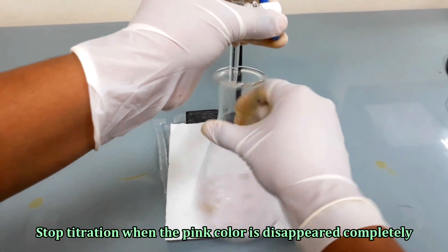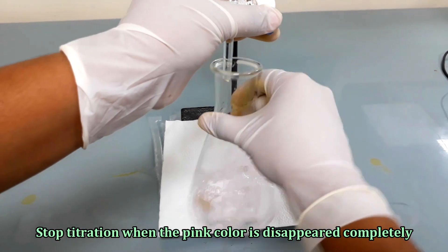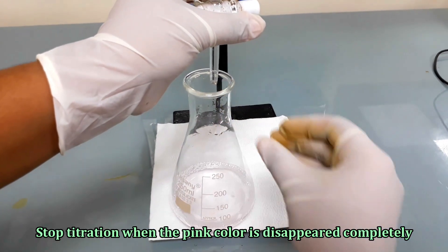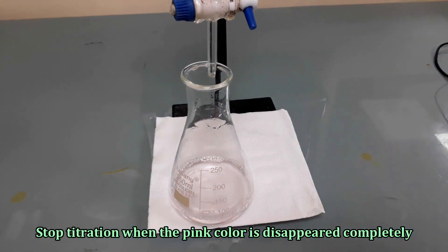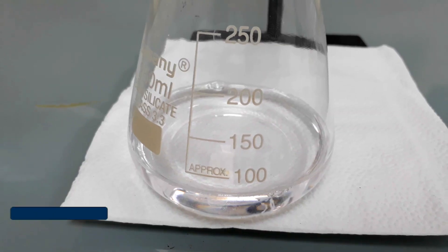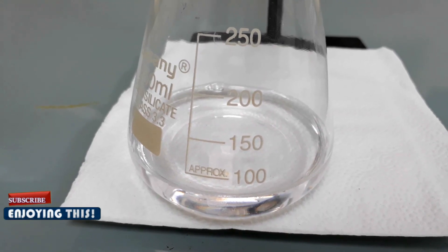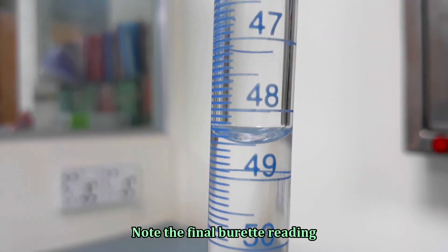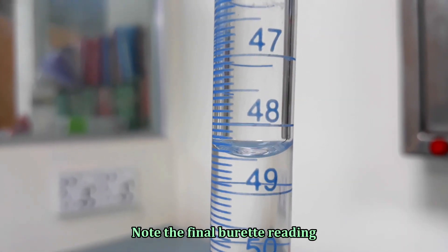Stop titration when the pink color has disappeared completely. Note the final burette reading.